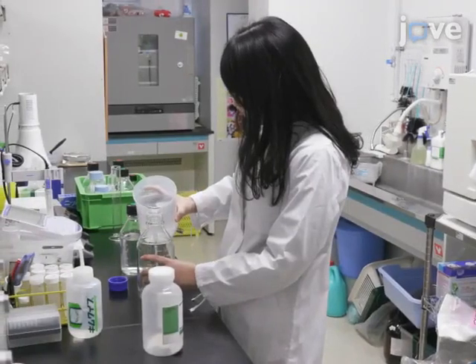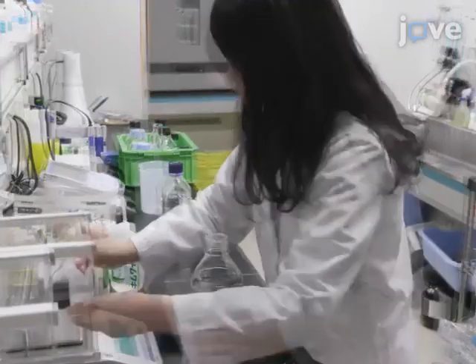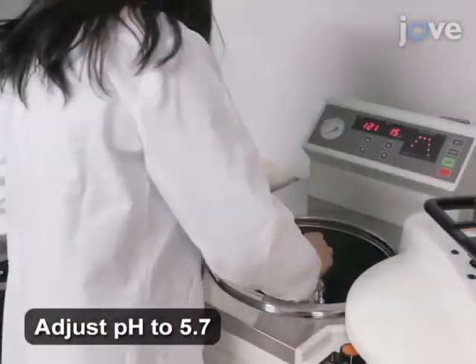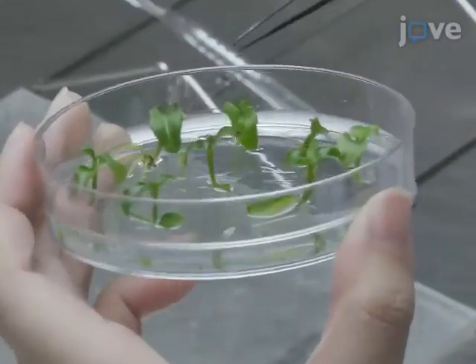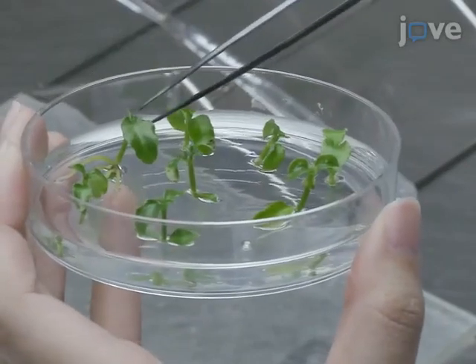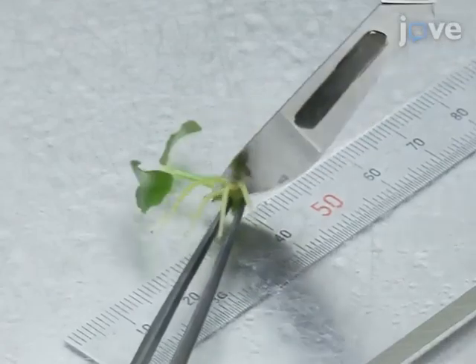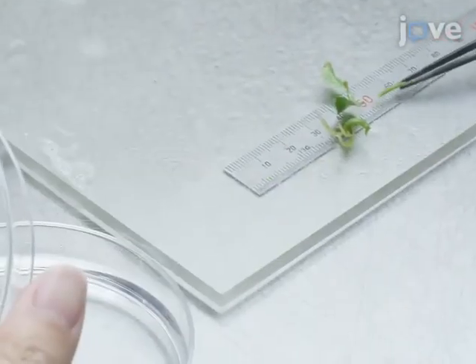To begin, prepare phytohormone-free B5 medium and add 0.2% gellan gum. Then autoclave the medium to sterilize it. Using a surgical scalpel on a sterile acrylic plate, slice 8mm internodal segments of Ipecac plantlets and place them on the medium.